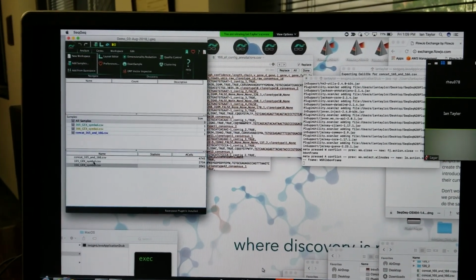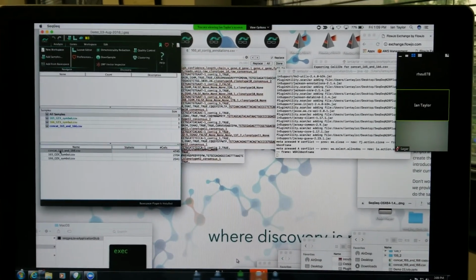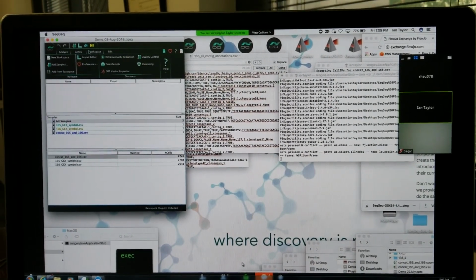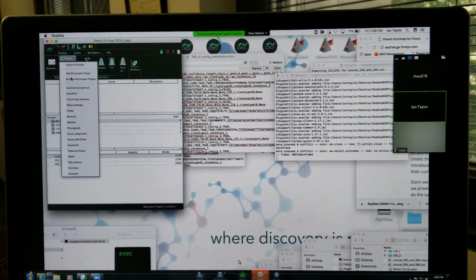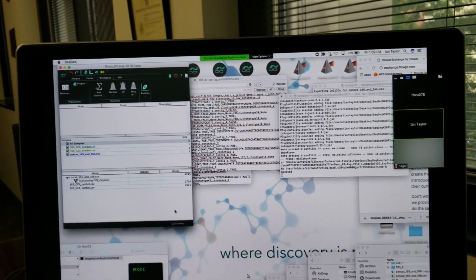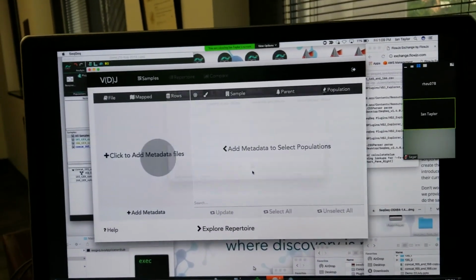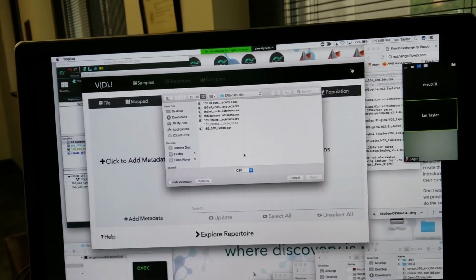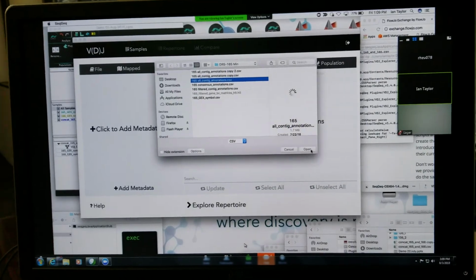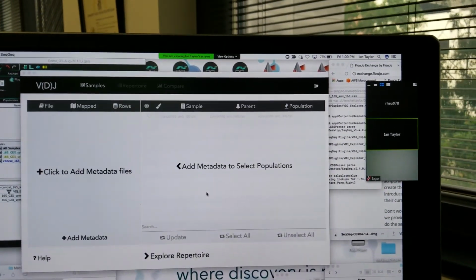Now I concatenated these two files together so that I can deal with the analysis of both data files simultaneously, hopefully. So if I go to the Workspace tab and look under plugins, you can see we have a long list of plugins released, the latest of which, probably the most exciting, is this VDJ Explorer tool, which should allow us to analyze the VDJ information associated with these cells. So I'll choose one of the meta information data files available there and just add it to this tool.